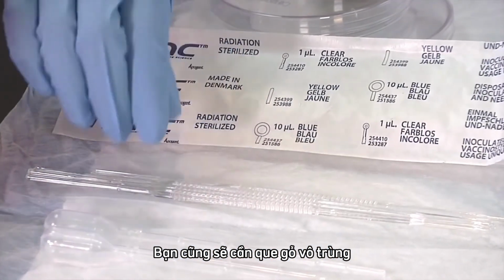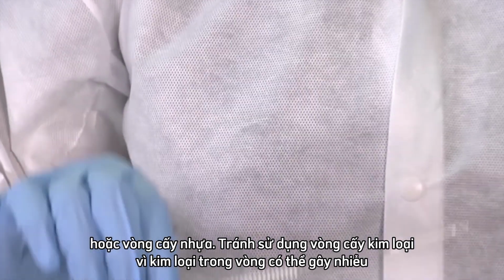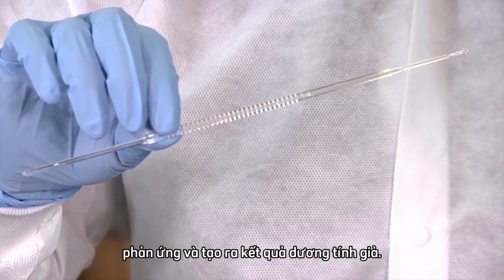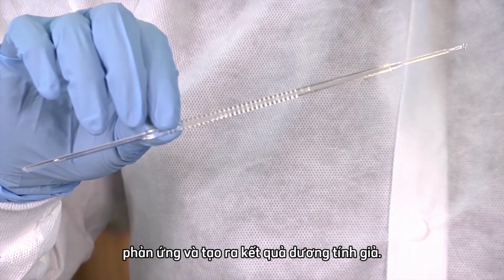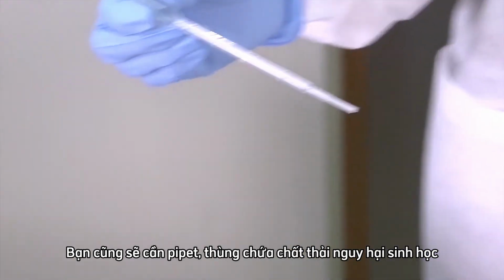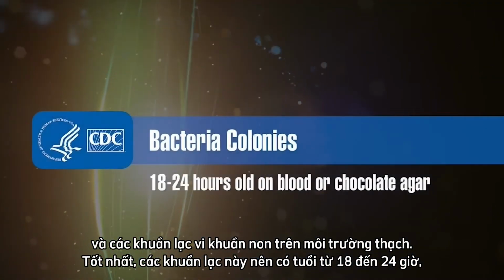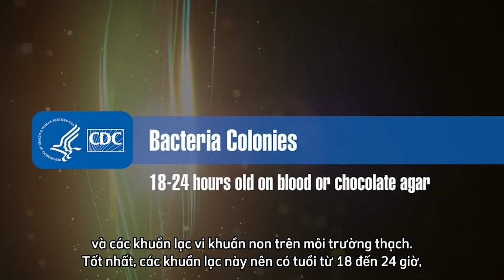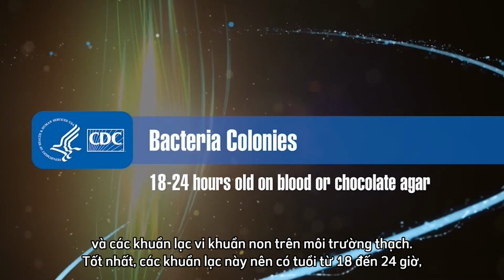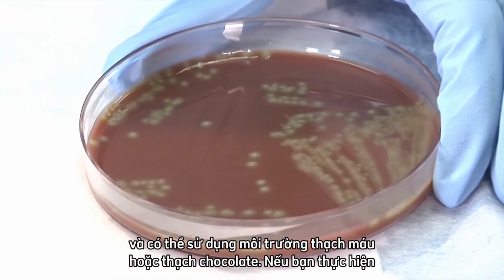You will also need sterile wood applicator sticks or plastic loops. Avoid using wire loops, because the metal within the loop could interfere with the reaction and cause a false positive. You'll also need pipettes, a biohazardous waste container, and young colonies of bacteria on agar media. Preferably, these colonies should be 18 to 24 hours old, and blood or chocolate agar media can be used.